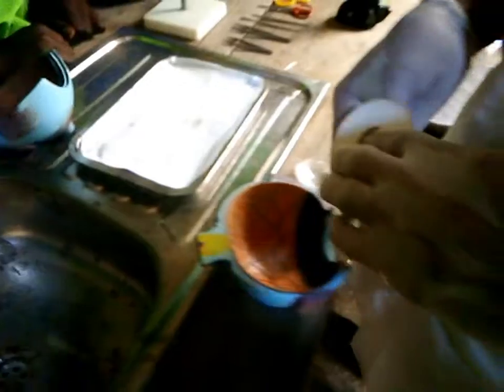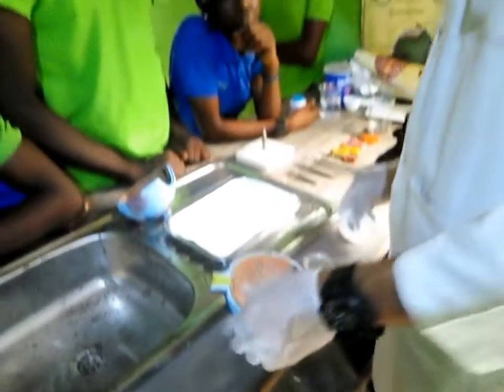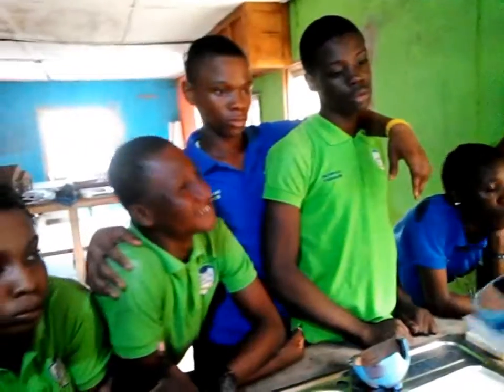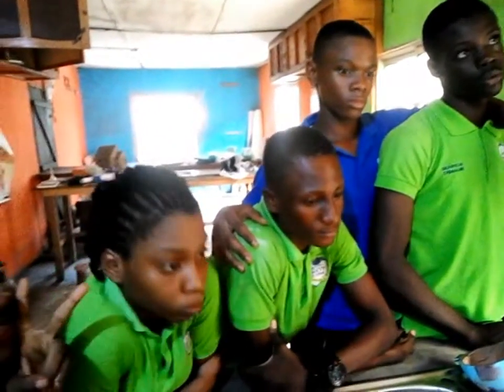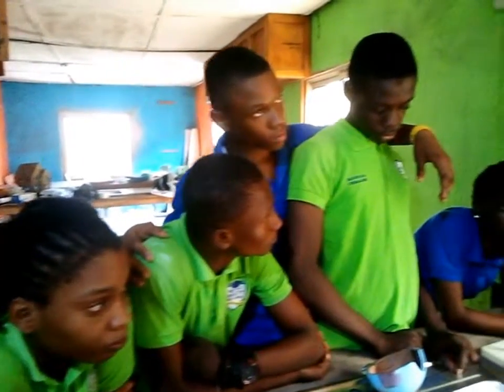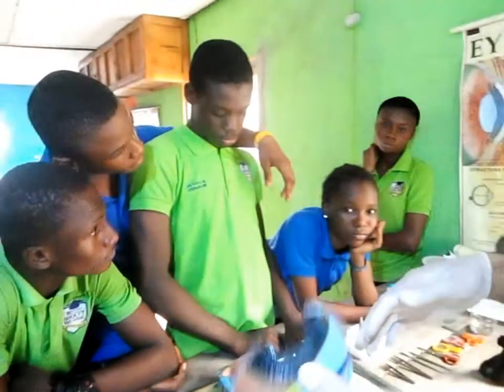So I believe with what I've explained, you should be comfortable with this part of the eye. Are you getting me? Now what you're seeing here are nerves and blood vessels. Are you getting me? That supply nutrients and oxygen to the eye, because the eye needs oxygen.